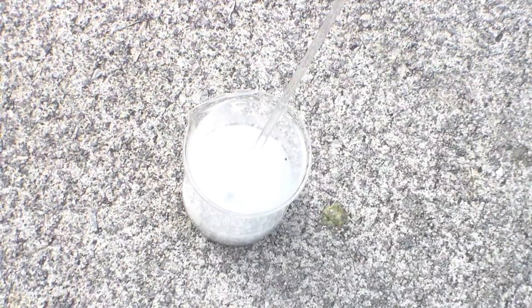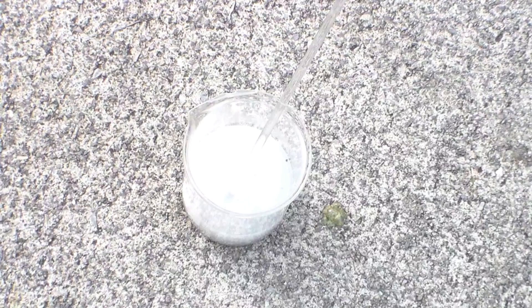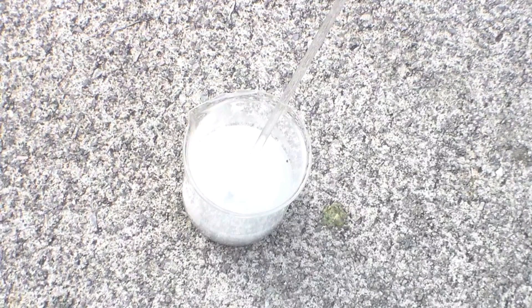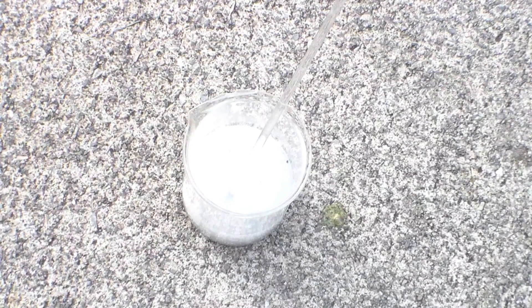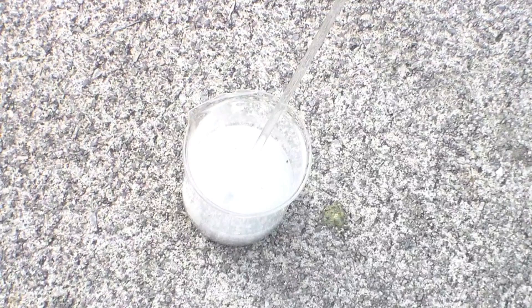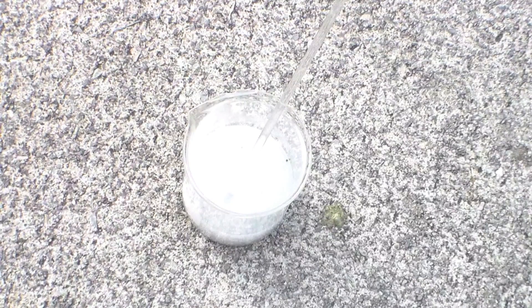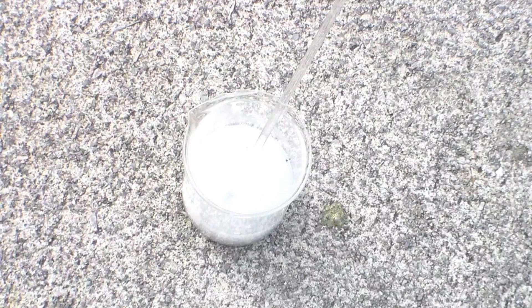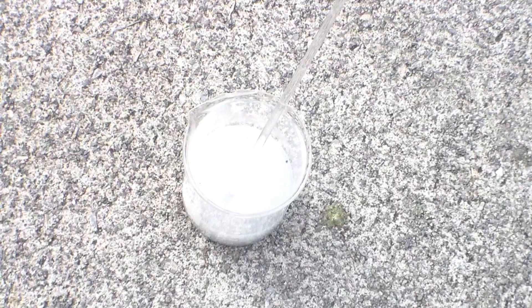Anyway, as you can see, no silane was produced here, which is either a really good sign and means that none of the silicon produced reacted with excess magnesium, so our yield will be higher. Or this could also be a bad sign, which is more likely, and it could mean that this reaction didn't work at all and that the magnesium just burned.